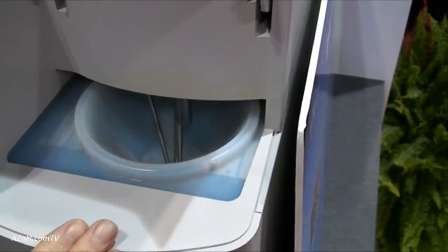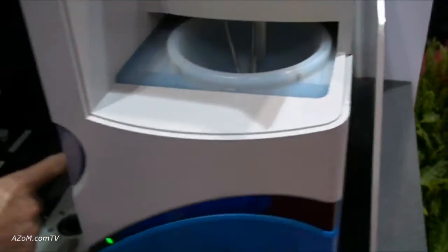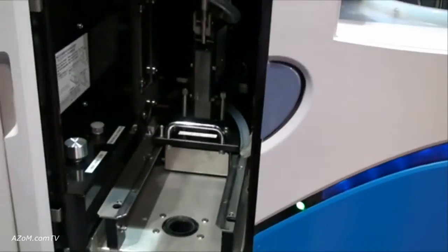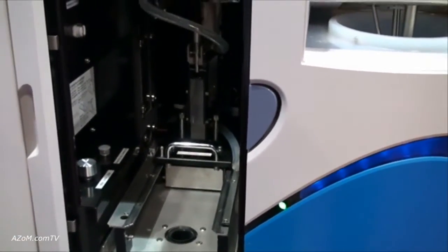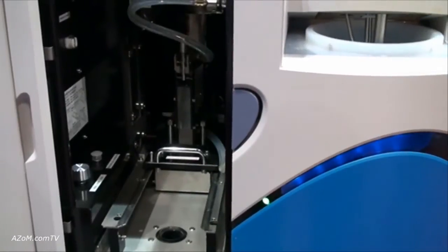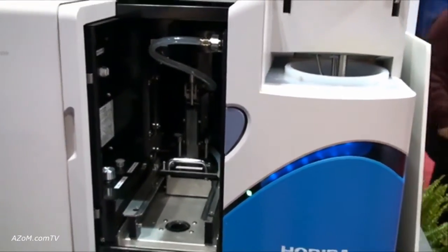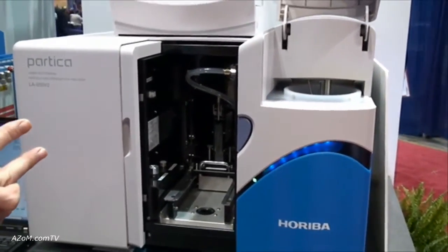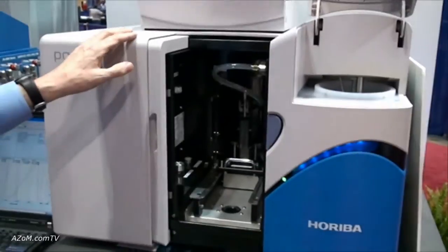When used for liquid suspensions, the sample is added here and passes down through these tubes through the cell where the measurement is made. The measurement only takes about 30 seconds — 45 at the most. We then clean up the system and prepare for the next sample. This leads to one of the reasons why this is so popular: you get a quick, reproducible result in about a minute.